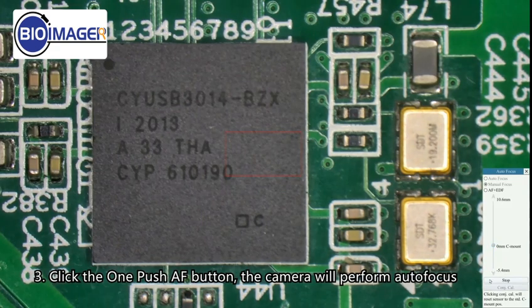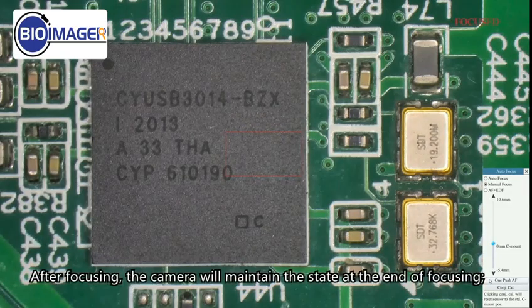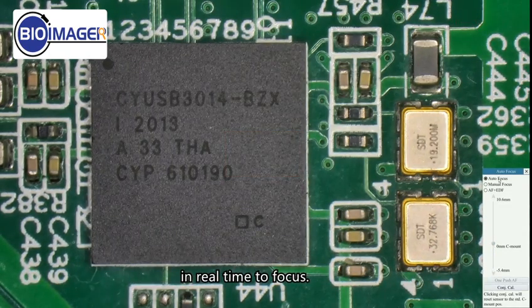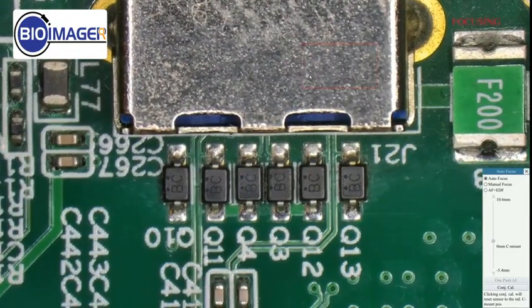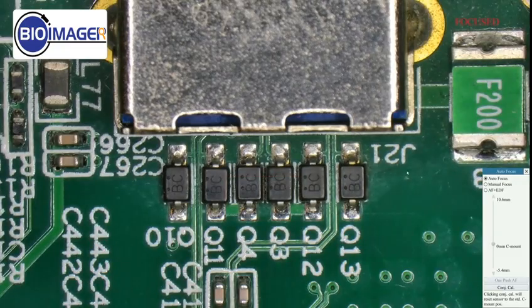Click the push AF button. The camera will perform autofocus for once. After focusing, the camera will maintain the state at the end of focusing. Click Autofocus. The system will monitor the clarity of the focus region in real time to focus. If the focus region changes, the focus operation will be triggered again.